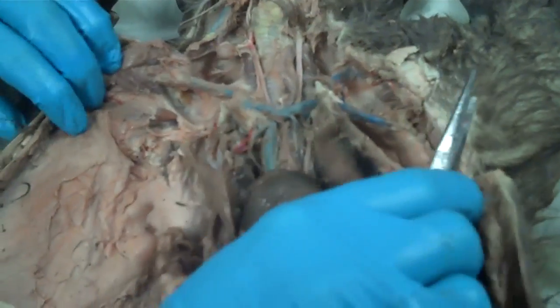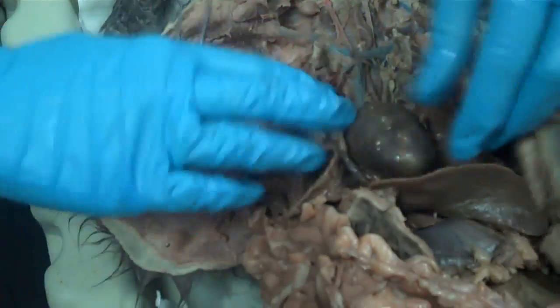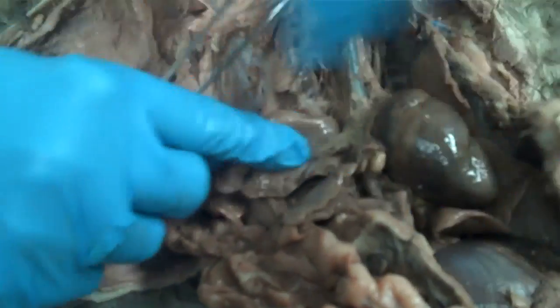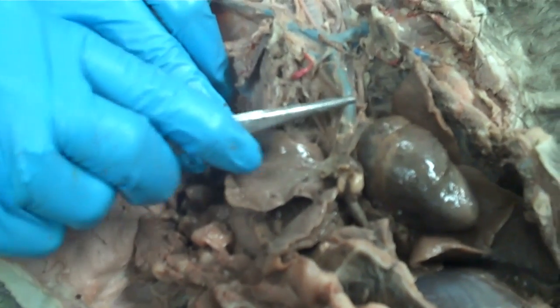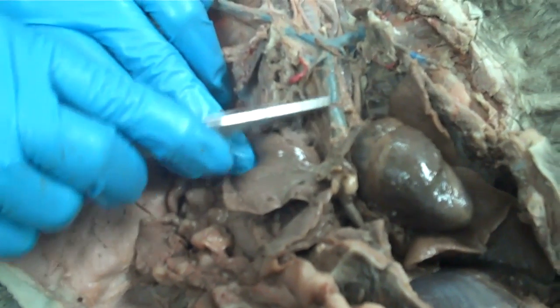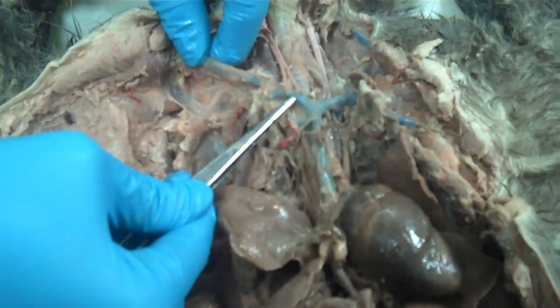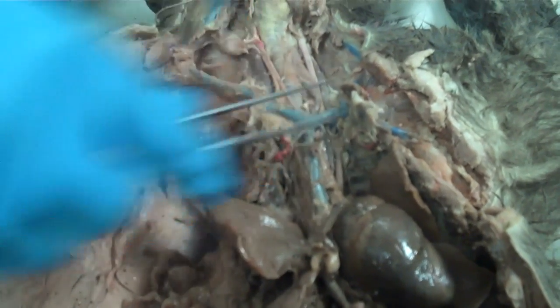The other vessel coming out of the top of the heart is this blue one. This is the superior vena cava. It will go up and then branch into a Y, becoming the brachiocephalic here and here.